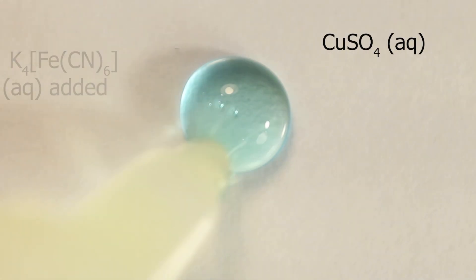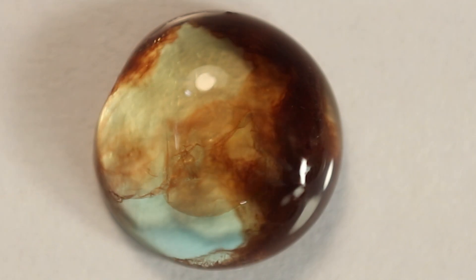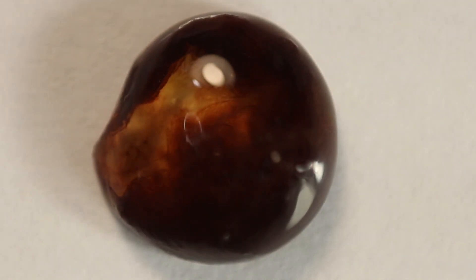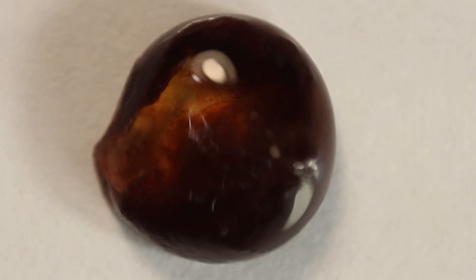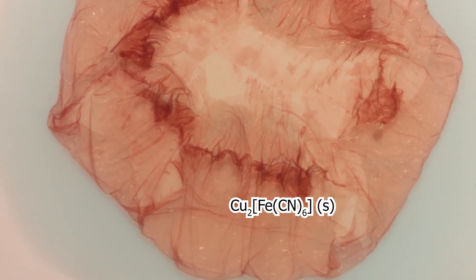On the microscale this looks like a catastrophe on some planet. Or if the droplets are flat, chocolate brown precipitate looks like a remnant of some supernova explosion.